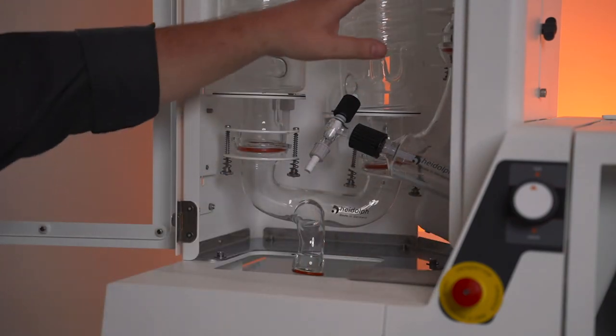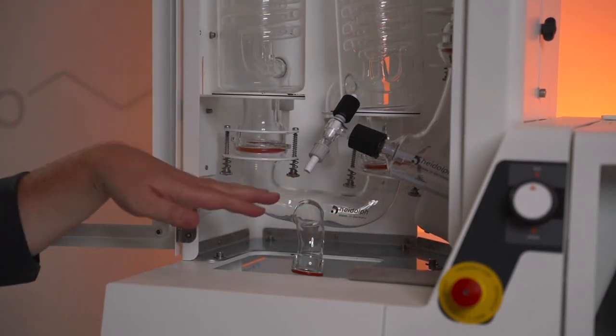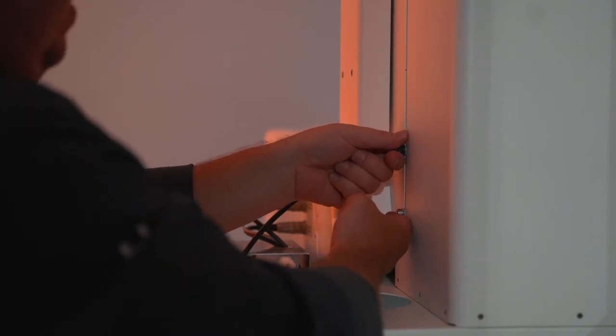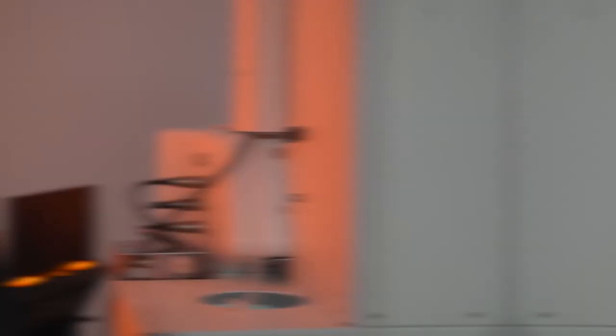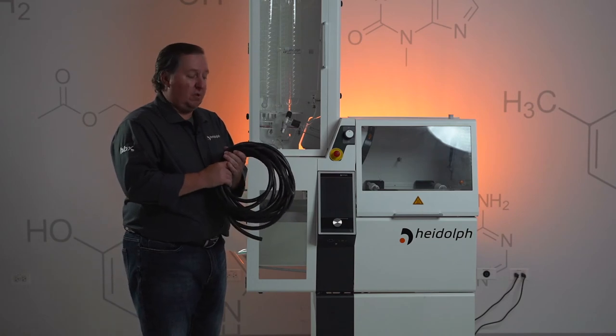Next, use the last of our KS64 clamps to get the back condenser connected to the Y-joint. Once we have that in position, we're going to want to lift up the back condenser so that our Y-joint is nice and level. To get our back condenser level, loosen up this wing nut, press up about an inch or so, tighten it down, and we should be in place. After we get our Y-joint in place, the next thing we're going to want to do is install our liquid lines.